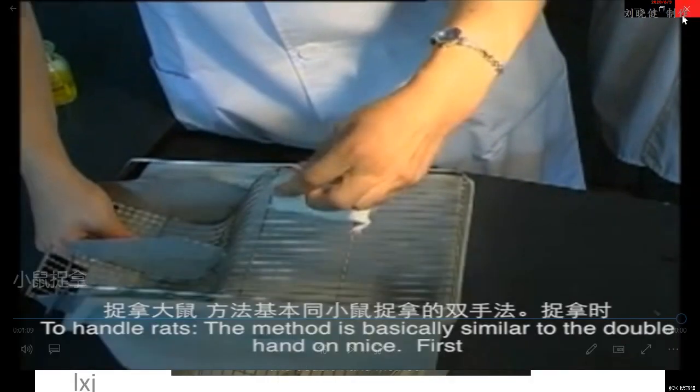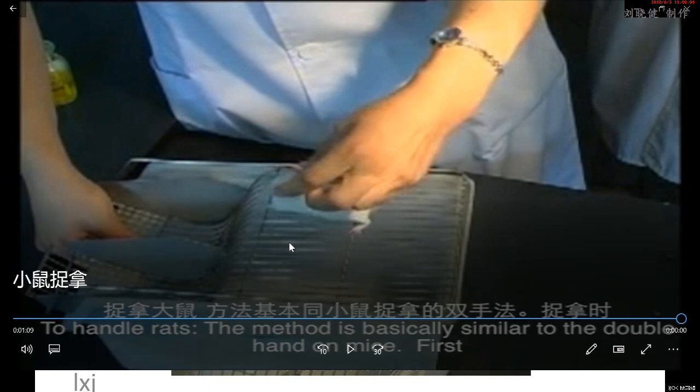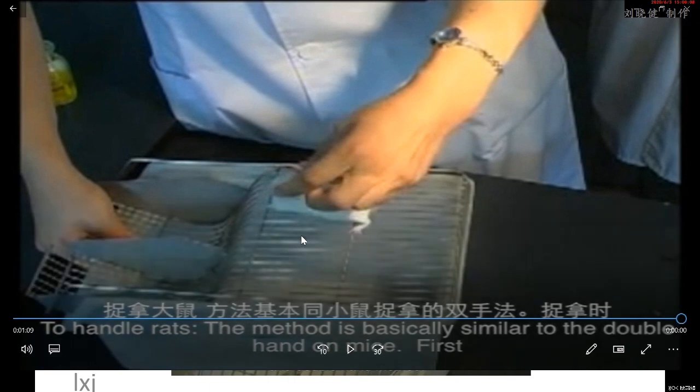Okay. Handle them by the correct method. It can help you to avoid being bitten by them. You know, the mouse is very common during experiments. Even after graduation from our university, maybe you want to get a master's degree.